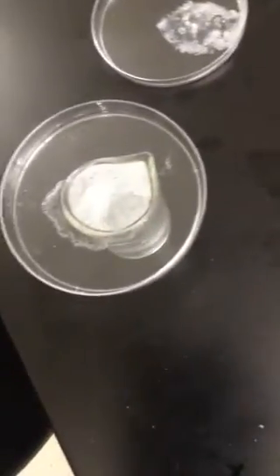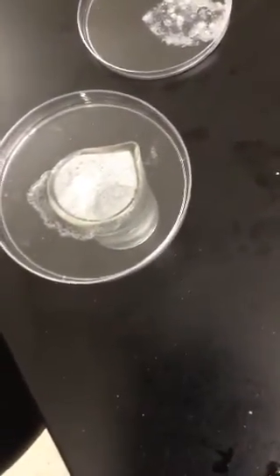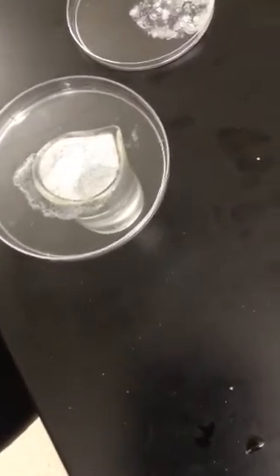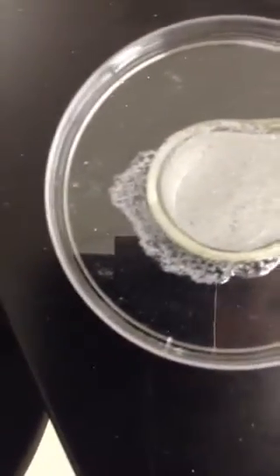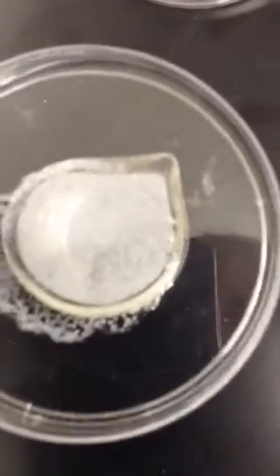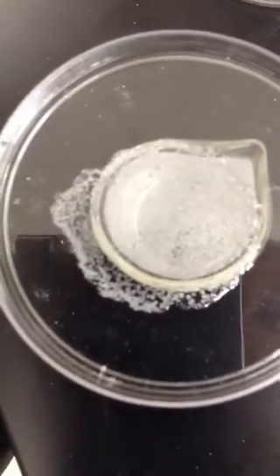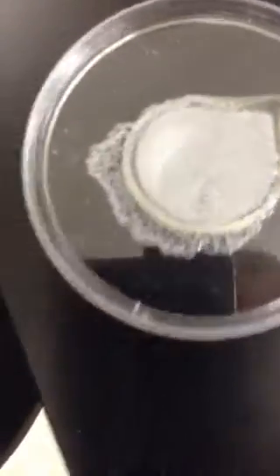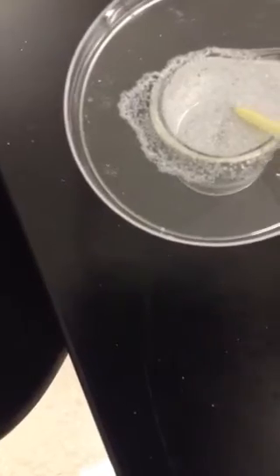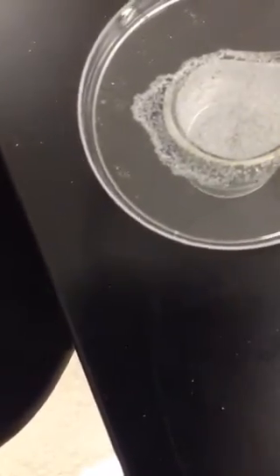So it's hard to tell. There's a lot of condensation around the solution itself. But if you look to the side there, it's creating very, very fine particles. Very fine particles of crystals are forming. Very unique, very fine for each specific spot. But that's around the edge, the more room temperature part. Still hasn't melted right in the middle, where mainly the heat is coming from, in the middle of that beaker.